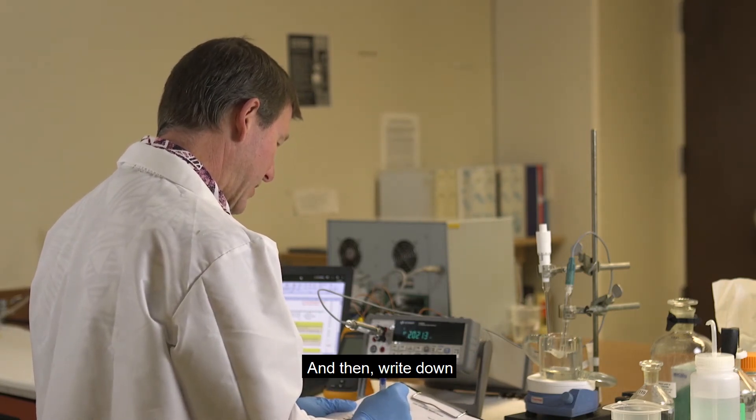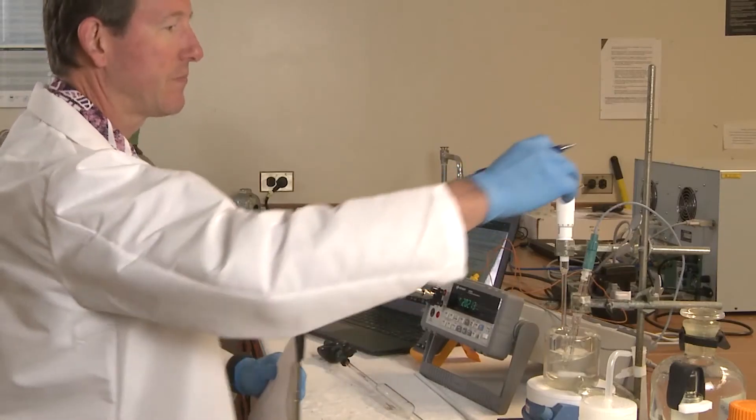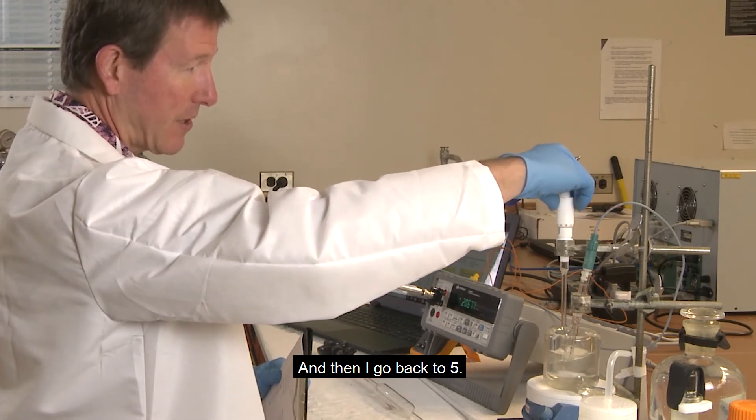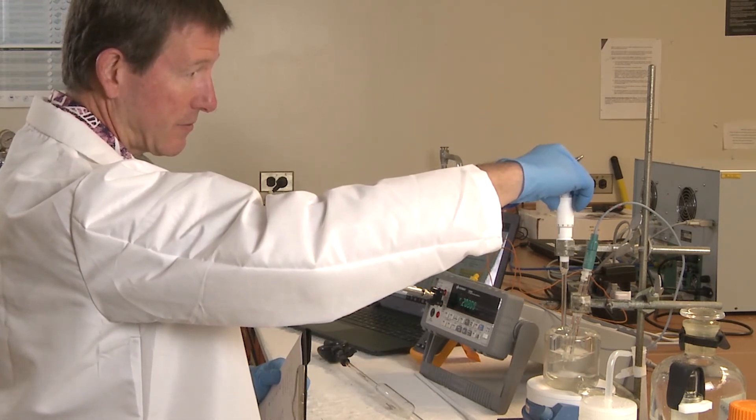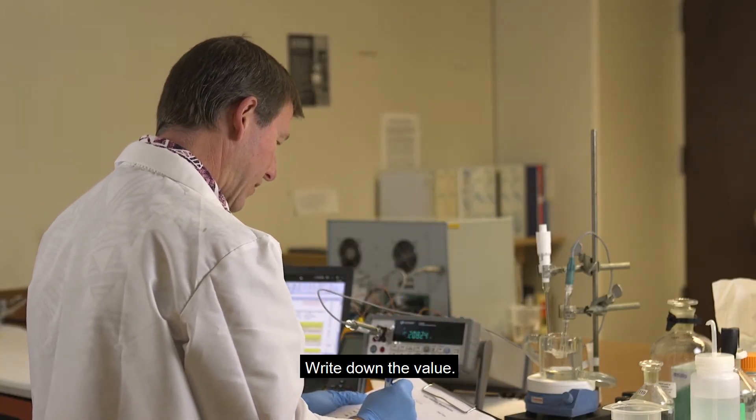And then write down the value. And then I go back to 5, write down the value.